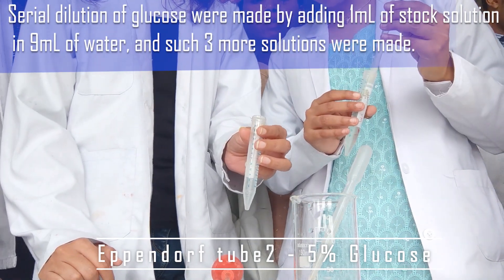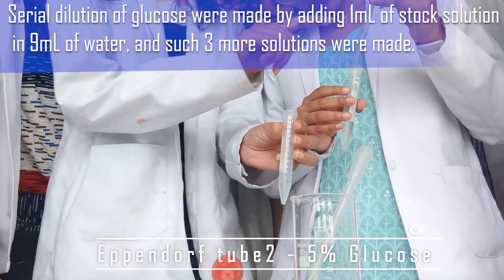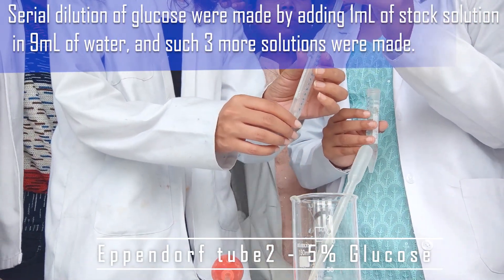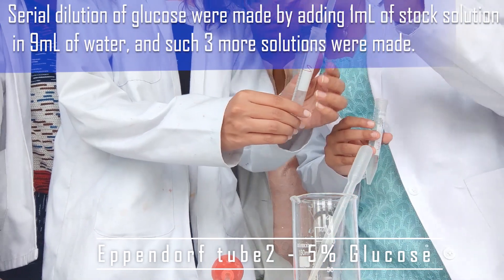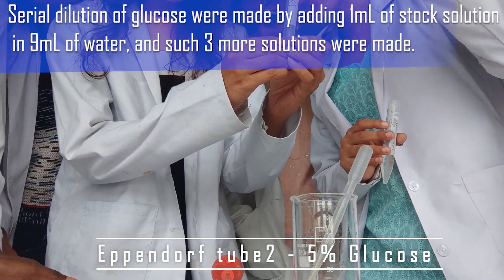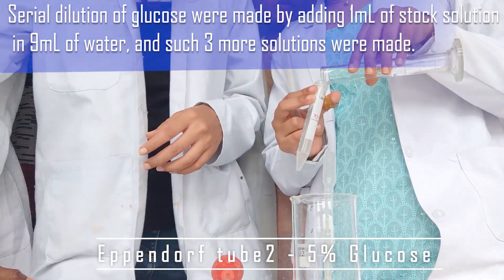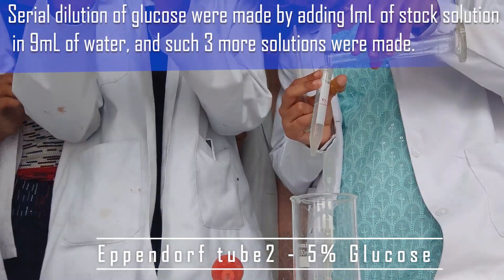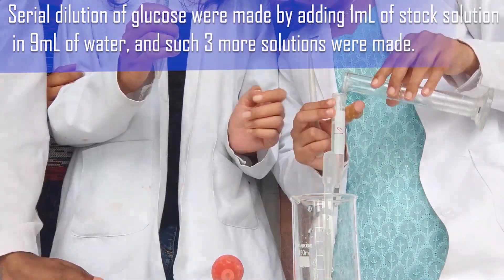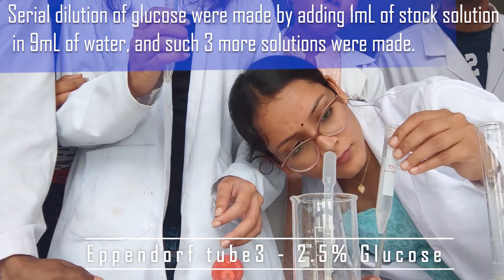Now take the second Eppendorf tube. From the first tube, take one ml of solution and put it in tube number two, then make it up to 10 ml. This is our 5 percent glucose solution. This is basically the serial dilution process, which we will be repeating up to four Eppendorf tubes.